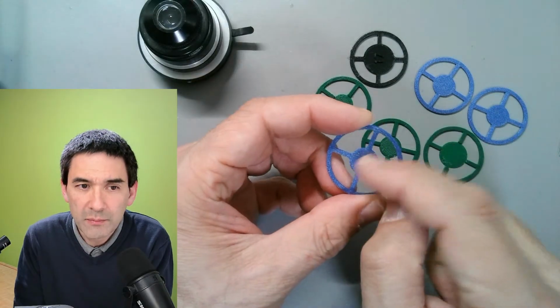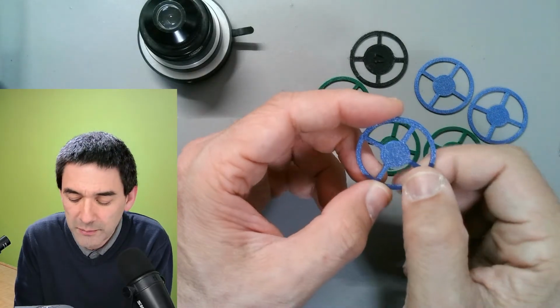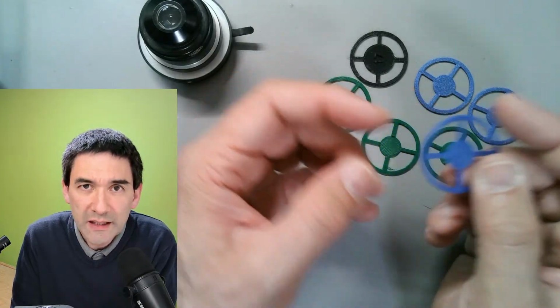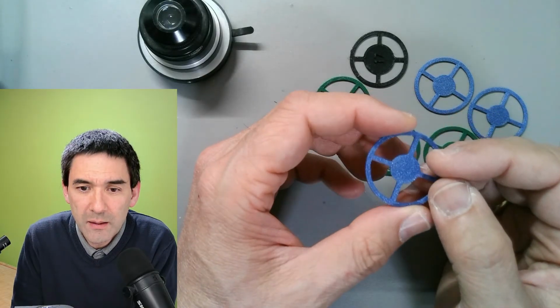Because by swinging it out a little bit, I'm able to adjust the light more precisely. This is actually a very delicate thing. If the size is not quite correct, then you already lose the effect a little bit.